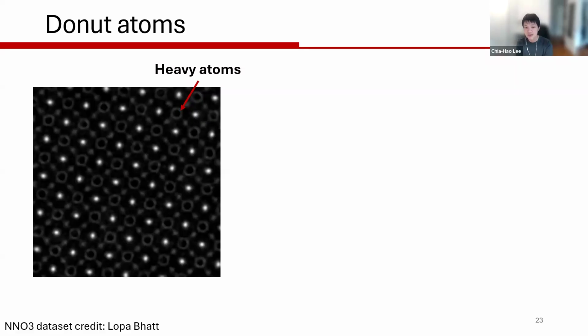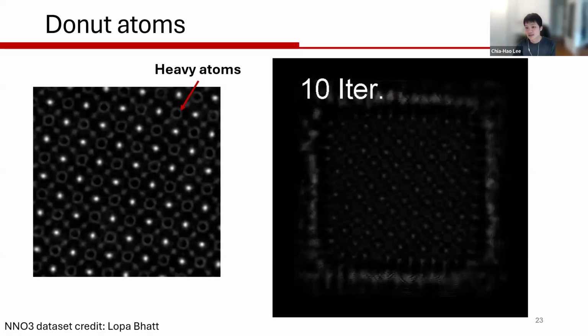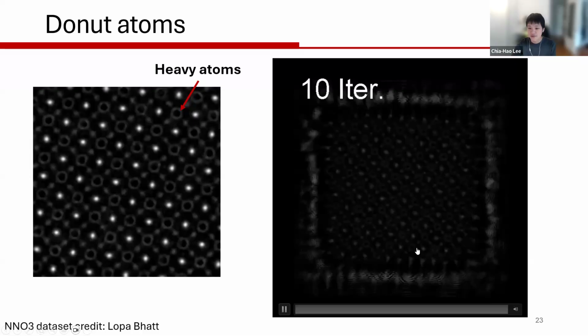And most commonly, people would attribute this to a phase wraparound artifact, or phase wraparound behavior in the reconstruction. And in PtyRAD, we actually experimented quite a bit to see whether we can reproduce this in a consistent way. But now we find that if you reduce the slice thickness to a reasonable amount, like 5 angstrom or thinner, depending on your Z number, you can actually remove these quite consistently by running a few hundred iterations.